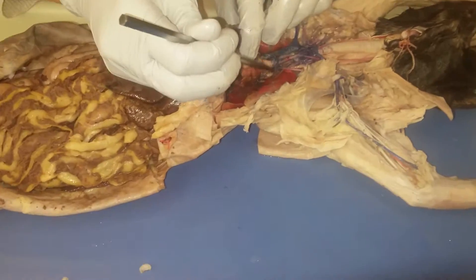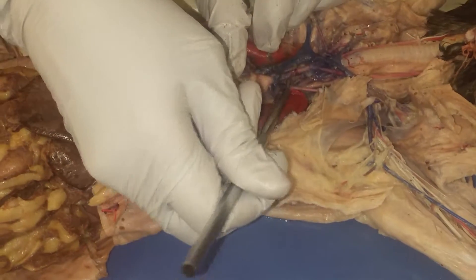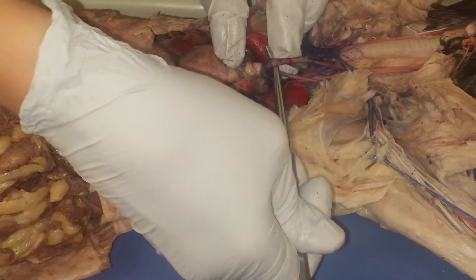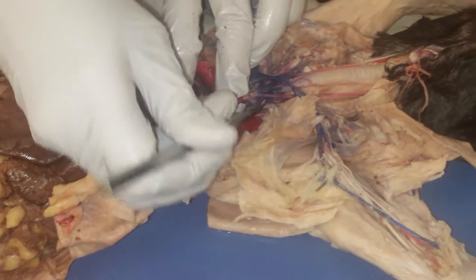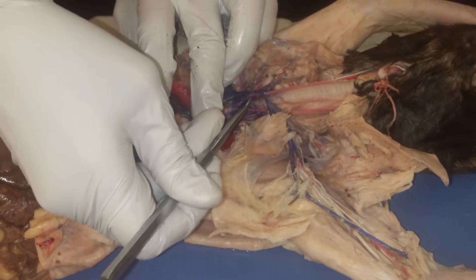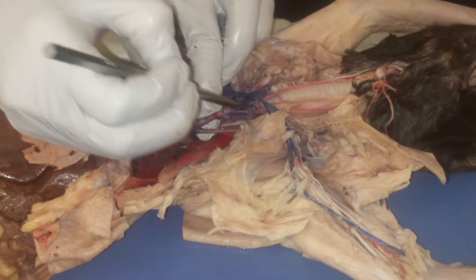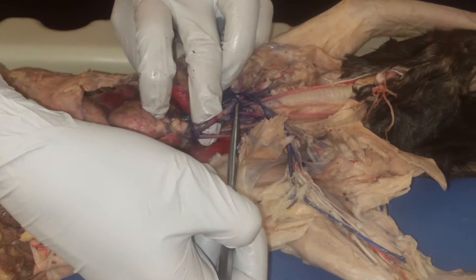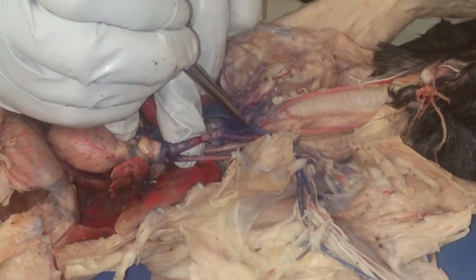If I pull this down here, here's my arch, here's your brachiocephalic artery. If I pull that down, I see three branches: a left common carotid, a right common carotid — they go up towards the head. Then I see a right subclavian.